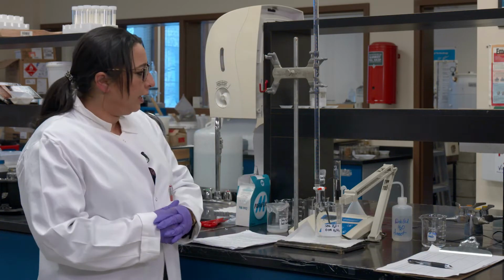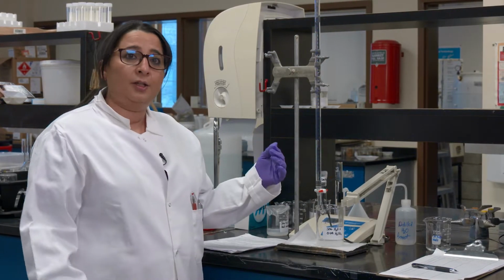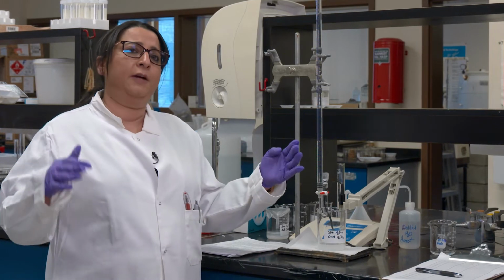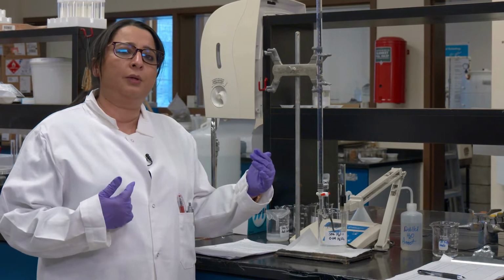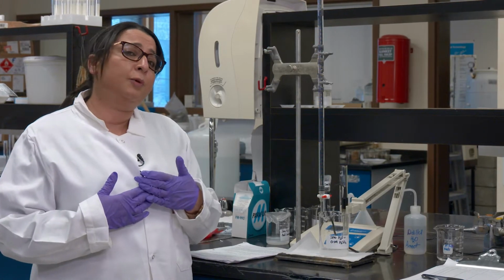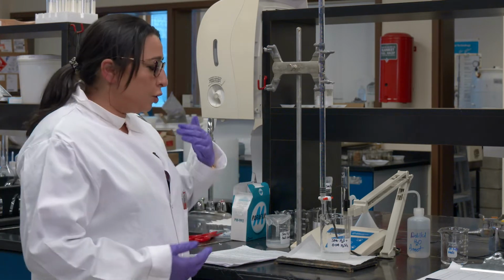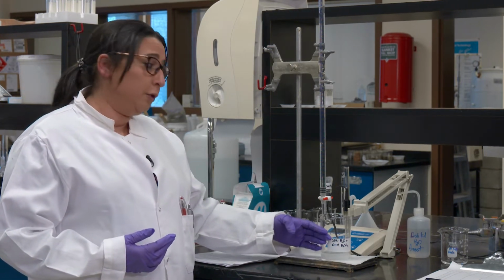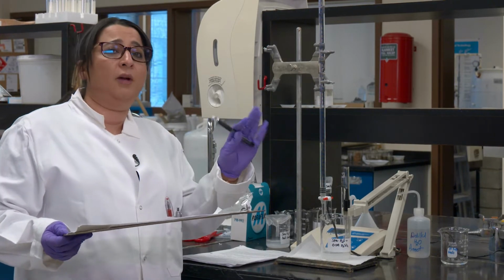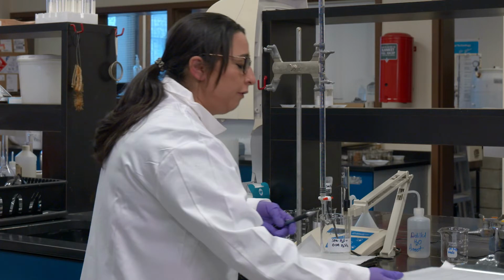Now here's the deal. I will keep adding the acid into my solution because I want to go to a pH of 3 or a little below 3. I'm starting at approximately 9.9, which is about 10, and I want to go all the way to 3 because, remember, in my introduction I told you that aqueous inorganic carbon has 3 different species of our interest: CO2, bicarbonate, and carbonate. All these 3 species of inorganic carbon occur at different pH. We are starting with carbonate because I just added the carbonate, which will be at the higher pH, around 9. As we move from carbonate to bicarbonate, we will be in the middle somewhere, hoping around 8 or close to neutral, and eventually when we are at the CO2 species, we should be really, really acidic in our solutions. So that's the whole point of this experimentation.